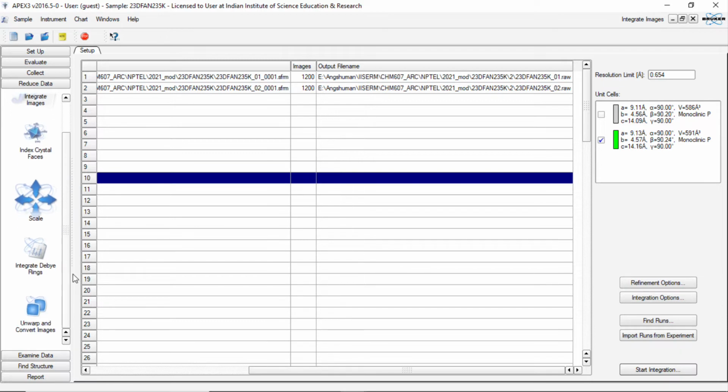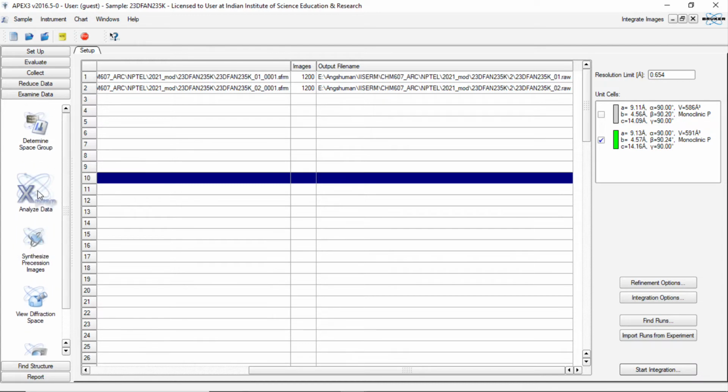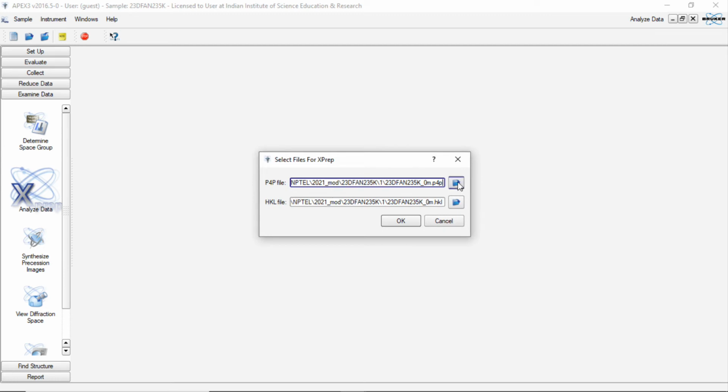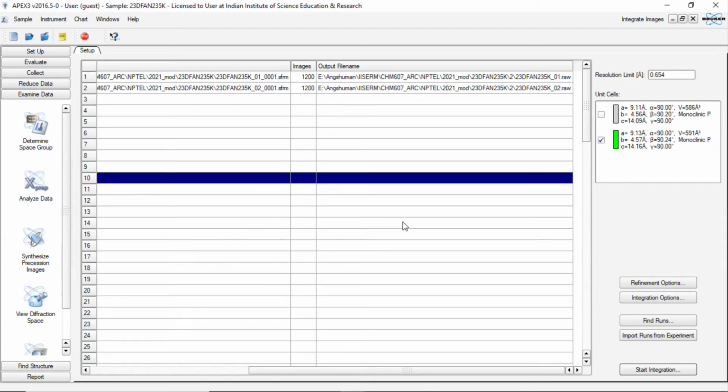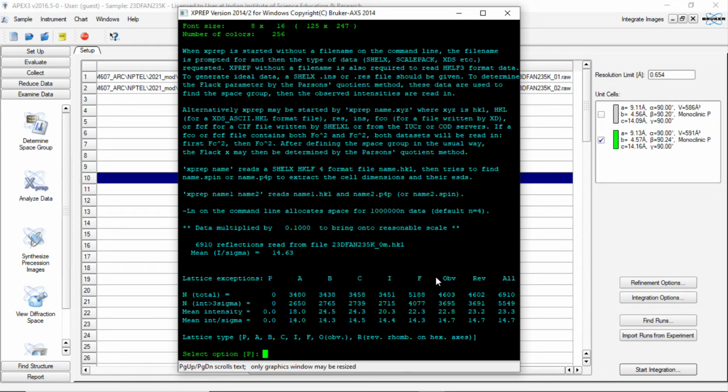Now we should go and look for something called XPrep. This XPrep will now read my HKL file in the set 1, because now the raw file after scaling is converted into HKL file. So now I am going to read that HKL file with the 0m.p4p, which has the information about the unit cell parameters of the cell gray that was determined in gray color. So now we have this window of XPrep, and in the past we have shown how this XPrep can be used. So here I am going to continue.